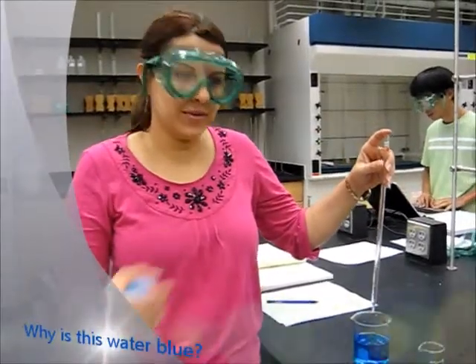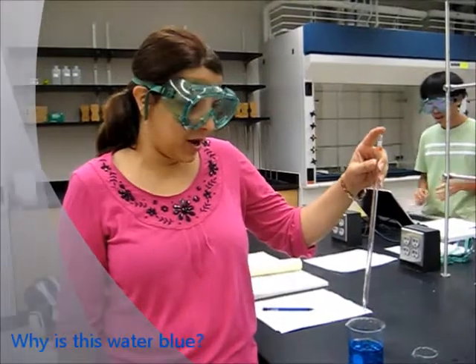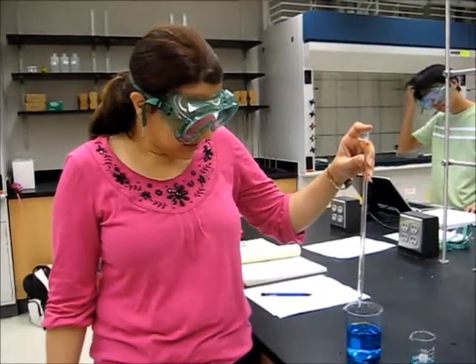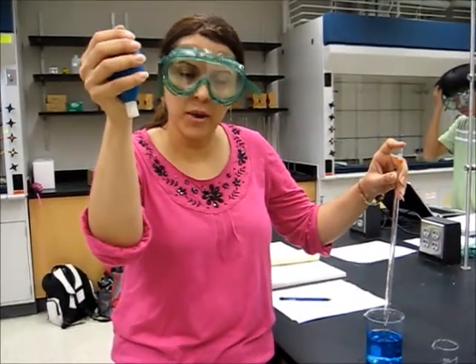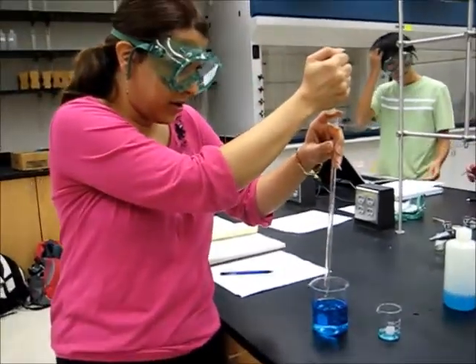We use the pipette in order to transfer liquids between different vessels. In order to use the pipette properly, we just hold it vertically and put our index finger on top of the pipette with another hand of ours. We get the pipette bulb and grip it and replace it with our finger.